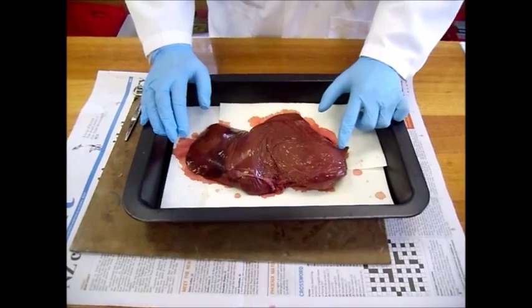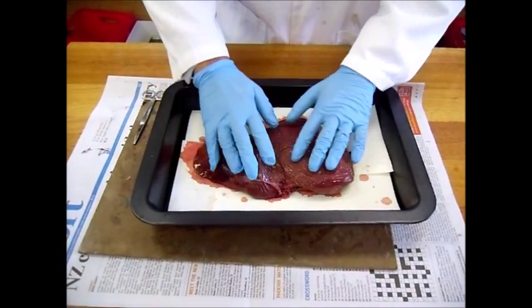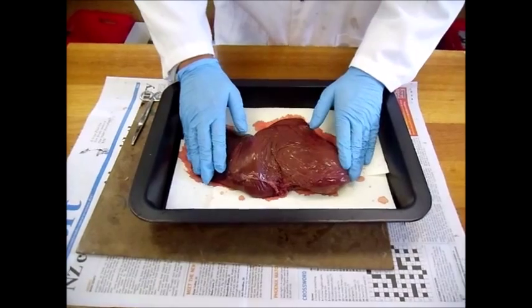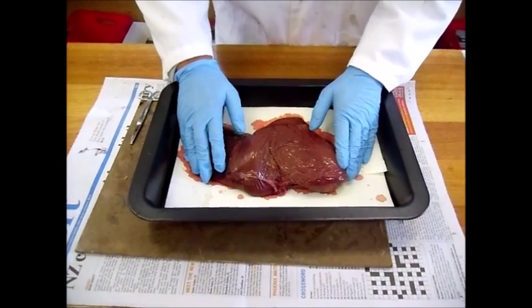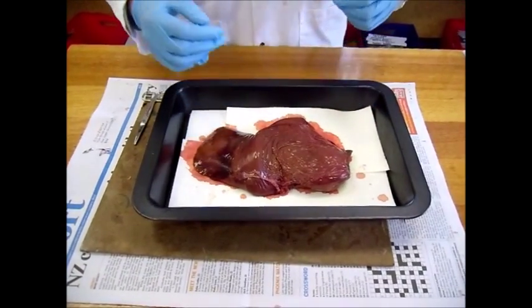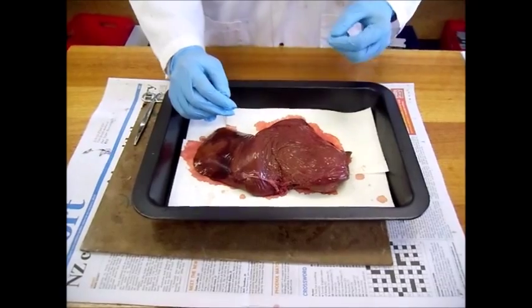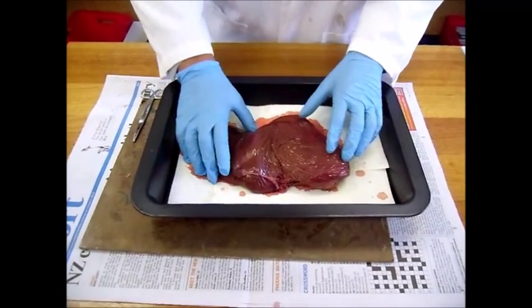Hello, today we will be doing the dissection, step by step, of the pig's liver. The liver is the second largest organ in the human body, after the skin, and this is most likely to be true for most mammals too.